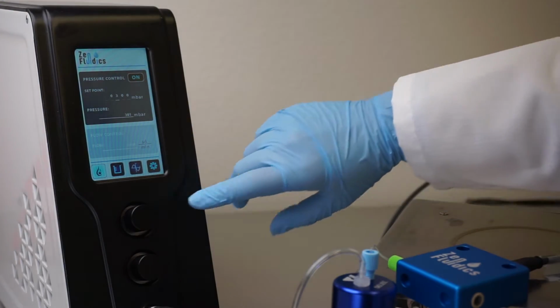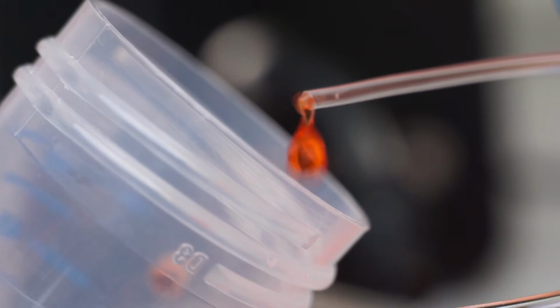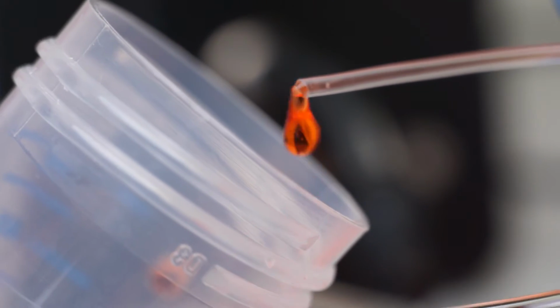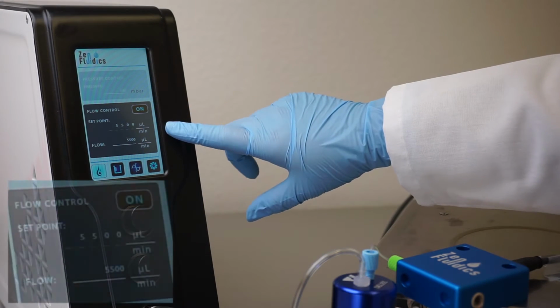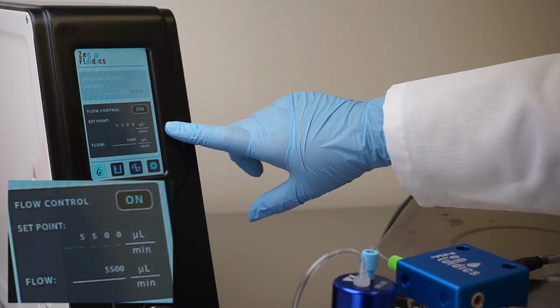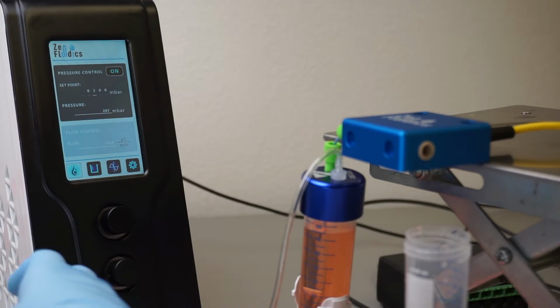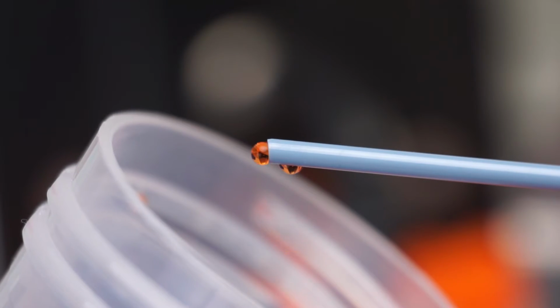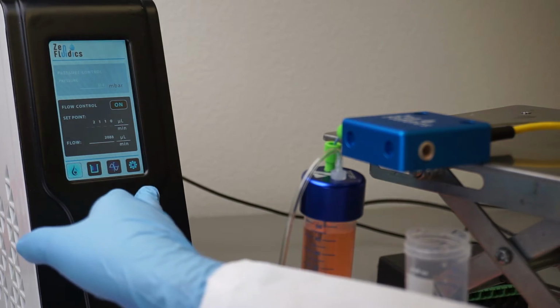To better appreciate the impact the radius of the tube has over the flow, we can apply 300 millibar to the system with a 500 micrometer diameter tube. The system easily goes over our desired limit of 2500 microliters per minute, and it even goes beyond the measuring capacity of its sensor. On the other hand, if we use a 254 micrometer diameter tube as our resistance, we stabilize the system. With the resistance, we also get a wider range of working values in case we need them.